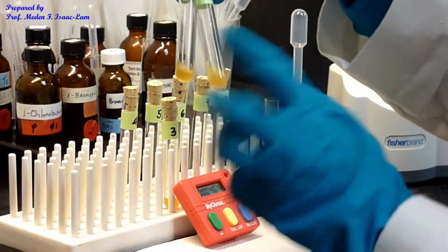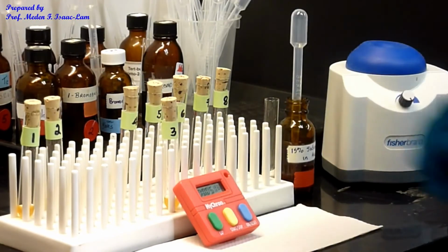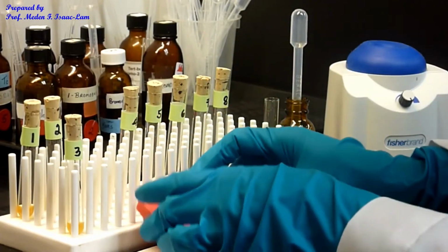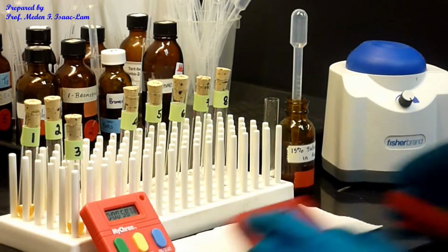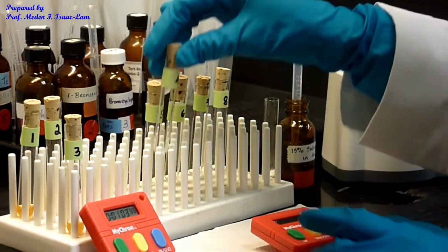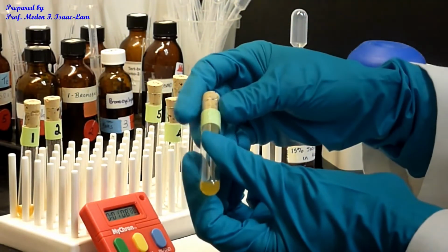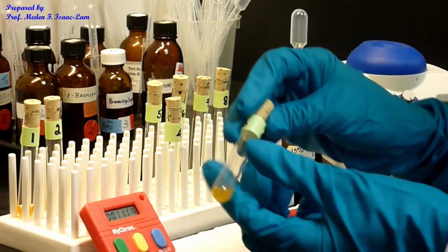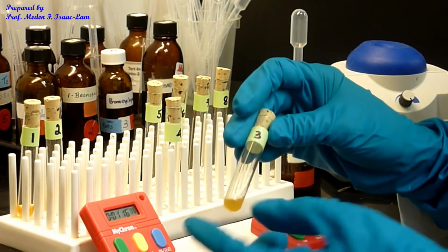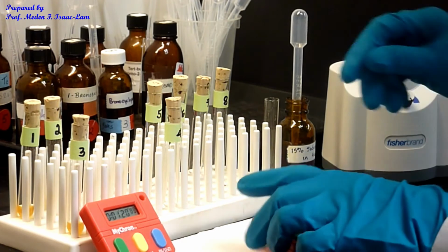Okay, so again, comparing 1 and 2, 2 has more precipitation. Okay, so this is like a minute here. So do it here. Okay, so now we're gonna reset it to 0, we're gonna do 4. So let's just check this out. I see about 1 minute and 12 seconds, I see some cloudiness already. So write that down, please, number 3 sample. And then we're going to do 4.